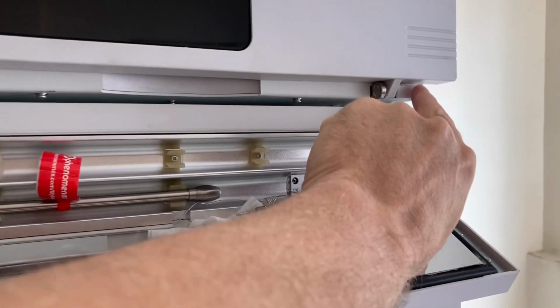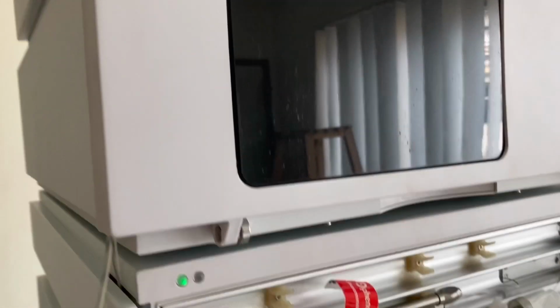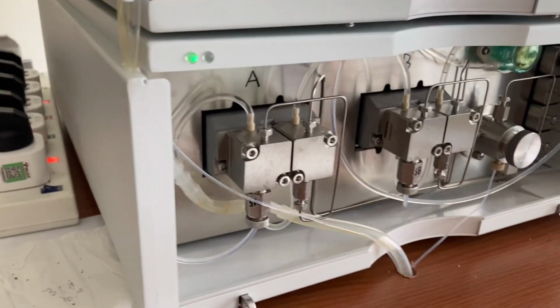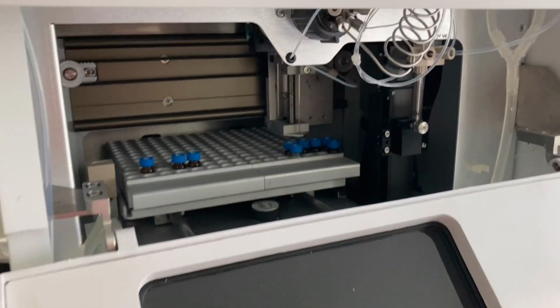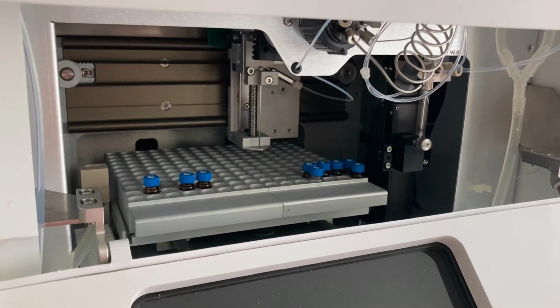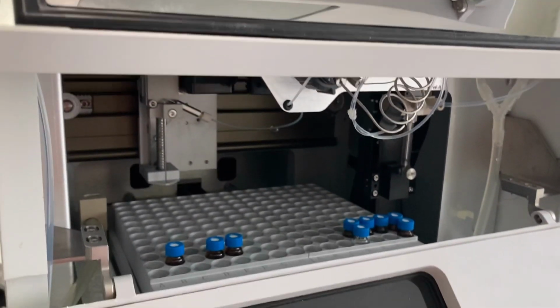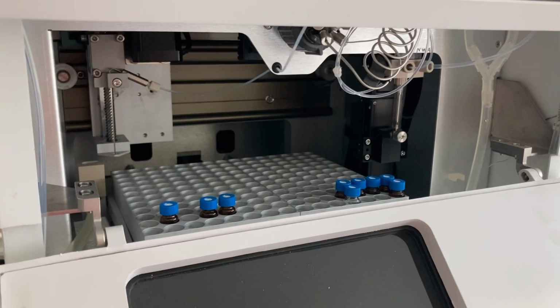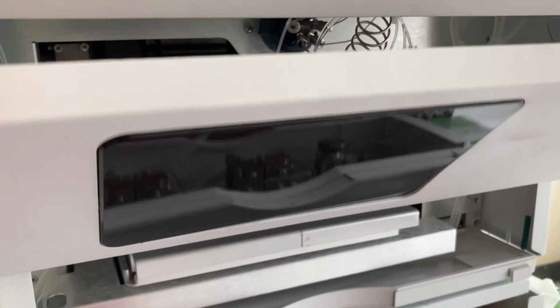That should be 5 switches. And then just check all the lights. See if there's any warning lights or one of them's not connected to the power or whatever. Sure looks good to go. So I just let it all warm up first. Everything will turn on, warm up, and then go over to the computer and turn the software on. Sure looks pretty good.